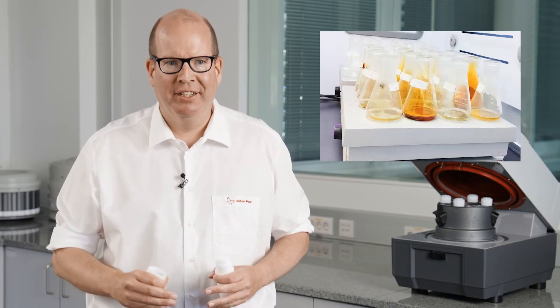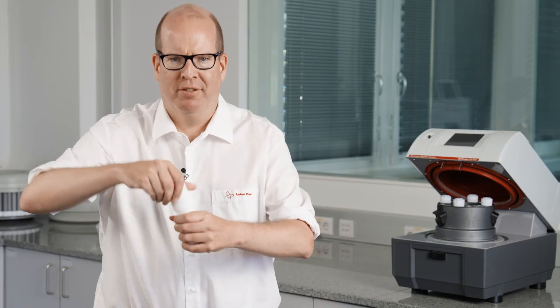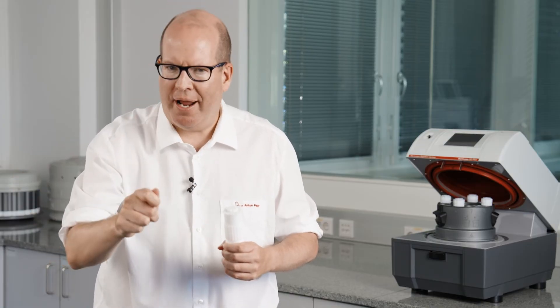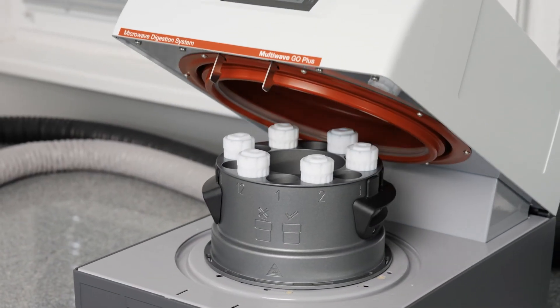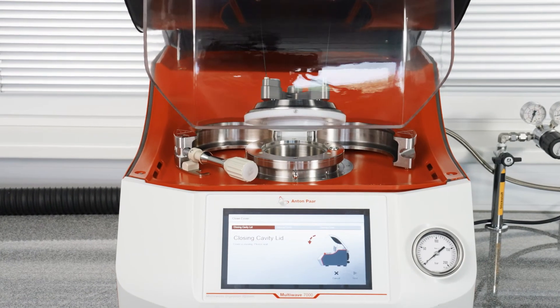How do I reach such high temperatures? A hot plate isn't going to be enough — you need to close the vessels, otherwise the acid will evaporate upon heating. But heating a closed vessel to a high temperature will also result in high pressure, and for that you need special instruments that can withstand both high temperatures and the built-up pressure, which can reach up to 200 bar. Modern acid digestion instruments even suggest appropriate temperature-time programs for individual samples, and such a method contains all important parameters for a complete digestion.